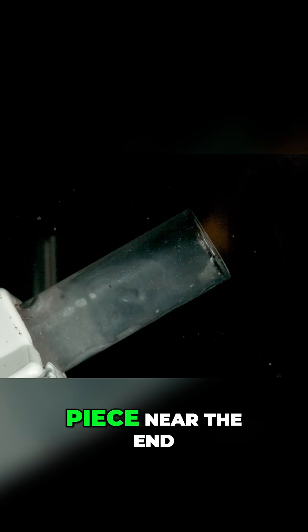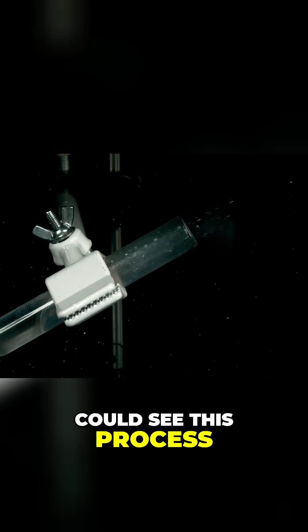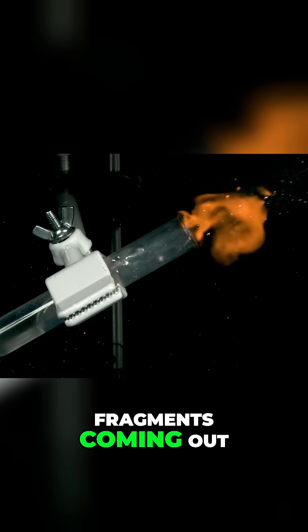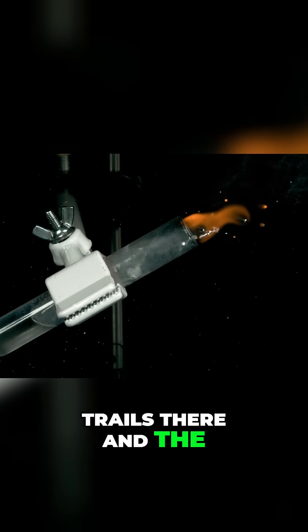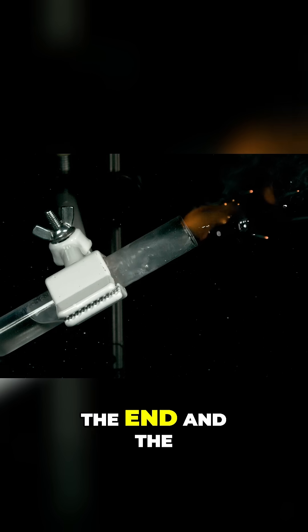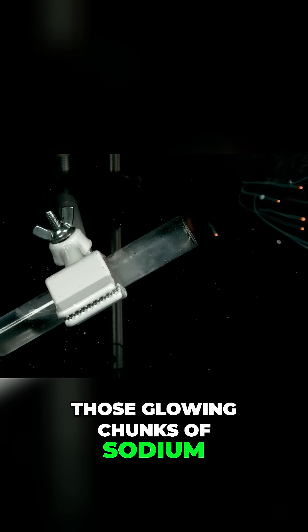Now look at this piece near the end. I wanted to do a wide shot so you could see this process happening here. You can see the fragments coming out, the ignition happen, all of the smoke trails there and the molten sodium flying out the end and the orange color fading to the background. You can still see those glowing chunks of sodium.